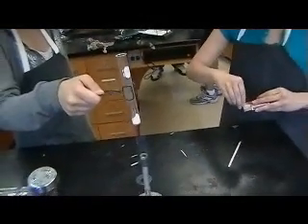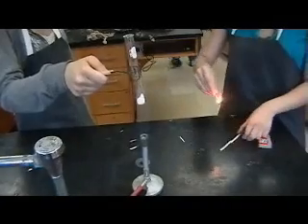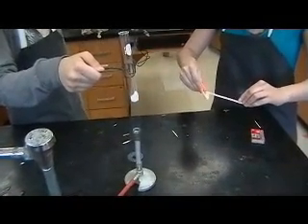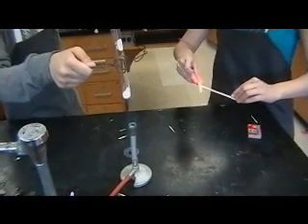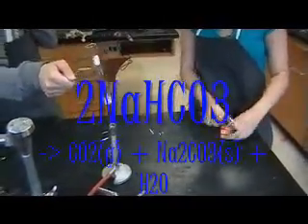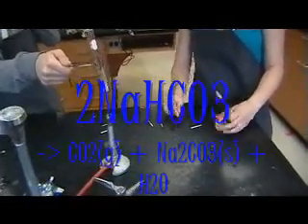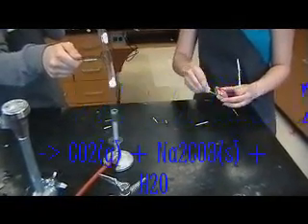Take the baking soda and put it directly over the flame. Heat the baking soda for about 15 to 30 seconds. The baking soda, sodium bicarbonate, should decompose into CO2 gas, sodium carbonate, and H2O.